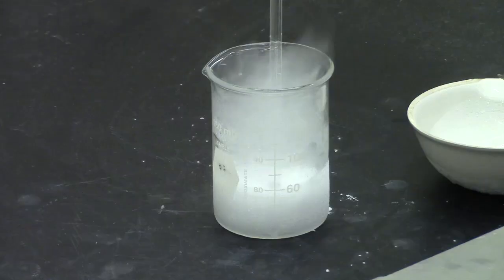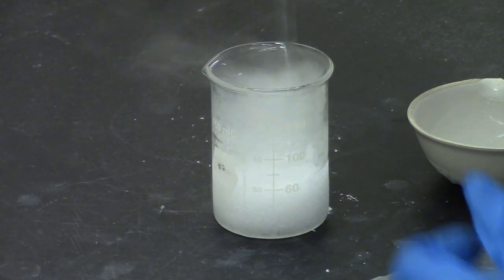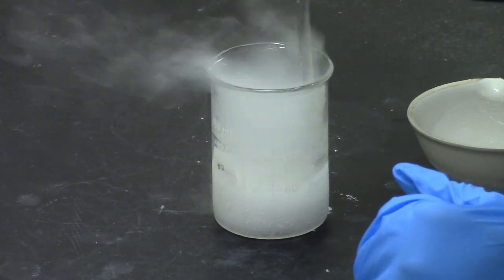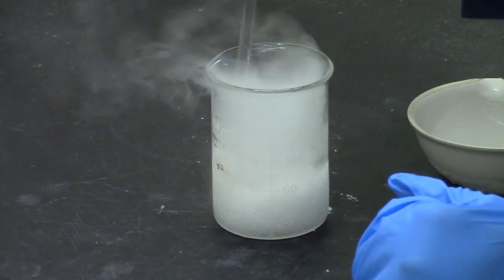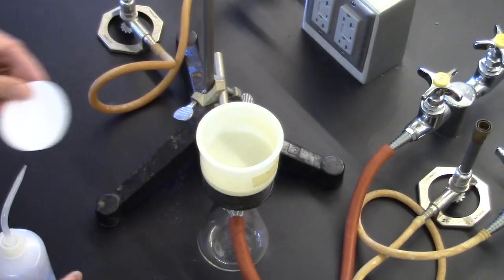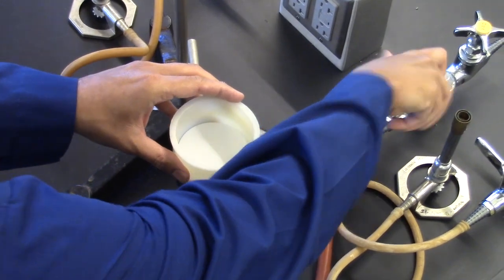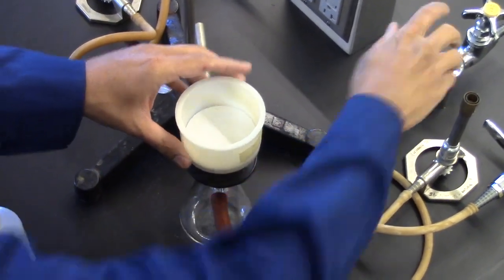Synthesis of sodium hydrogen carbonate. Coming up later, in order to get a good yield, you will have to work quickly and filter when there is a layer of ice on the outside of the beaker. Set up your vacuum filtration system so that all you need to do is turn the vacuum on and filter.